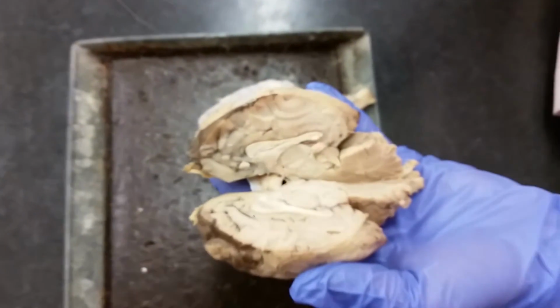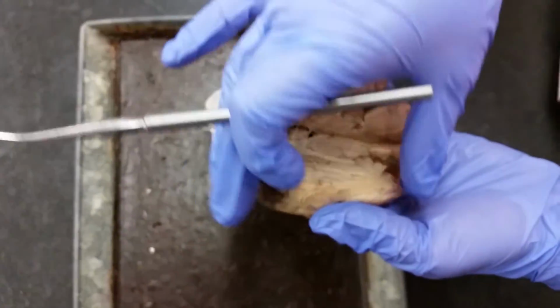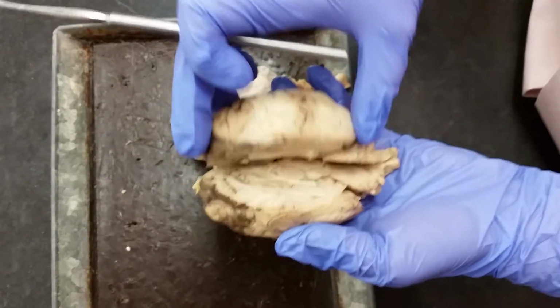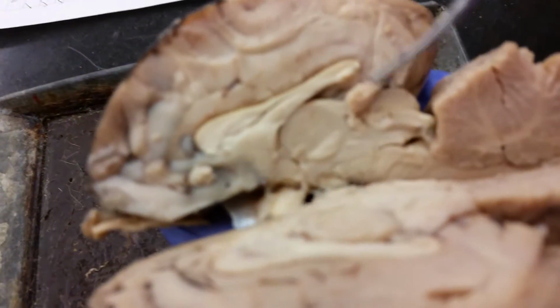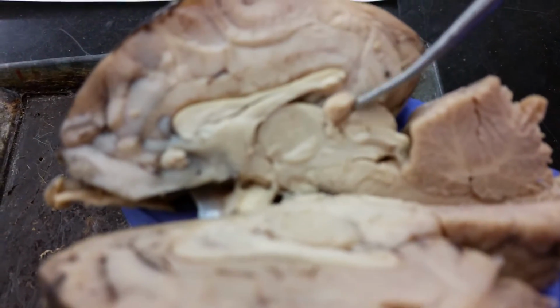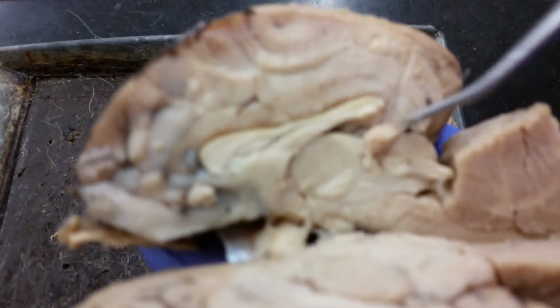It's very unique, so it's very easy to distinguish from your other structures. The cerebral hemisphere is something that you need to know. It's on your list, and so that's just going to be one hemisphere of the brain. This entire section is a cerebral hemisphere. The pineal body or pineal gland is here. I did not cut directly through it, so it appears on one side of the brain that I used today. So this is the pineal body or pineal gland.